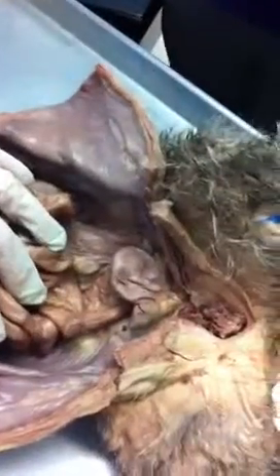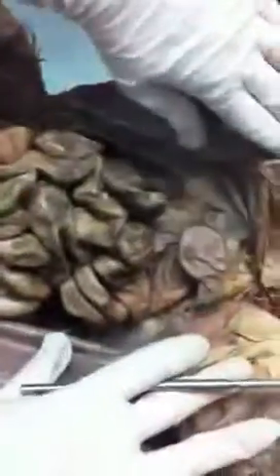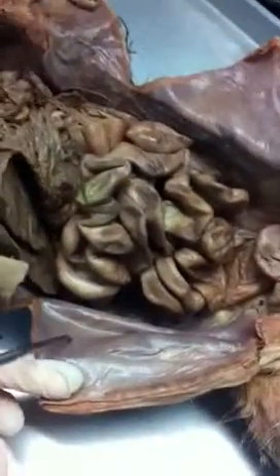Okay, so what is the structure here then? That's the kidney. What is this one over here? Kidney. Do you see any reproductive units in here? No. Okay. We had it taken out because this is a leftover scar, we believe, from her spaying. Okay? That's for females, right? Spaying. Okay. All right. Any questions?